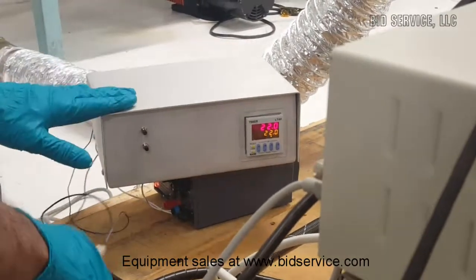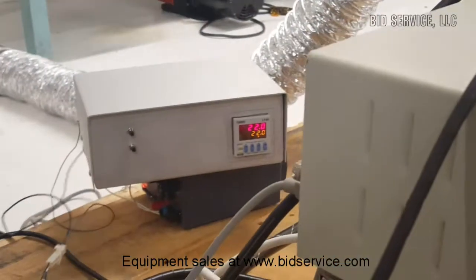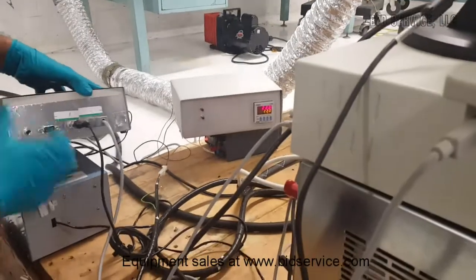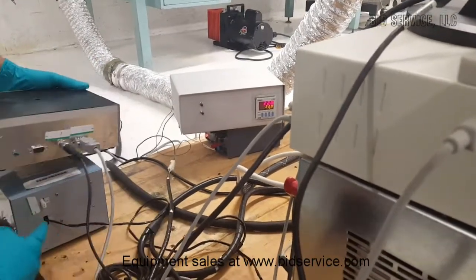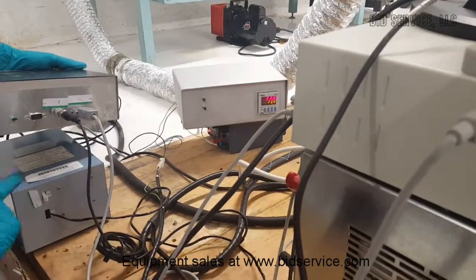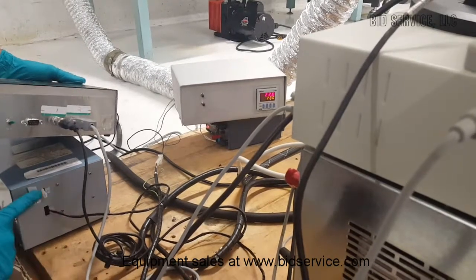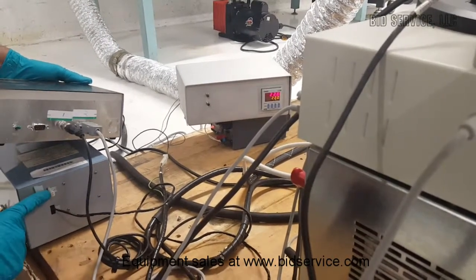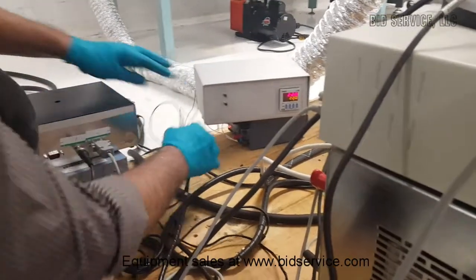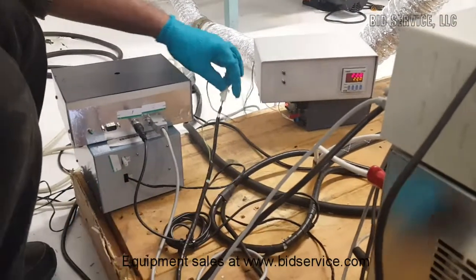power. So the signal from the computer goes to this module, which is an interface box, and from this box the output goes to this module, which is another box where the shutter power supply is generated. The output from the computer control is available here, where you disconnect this white Molex connector and connect it here, then it will be computer controlled.